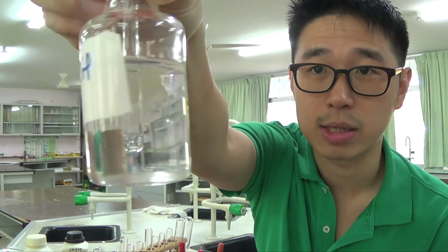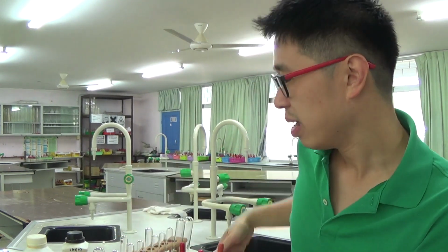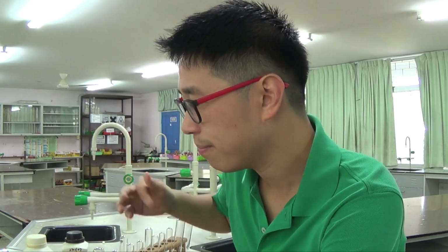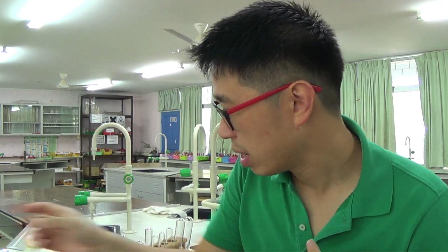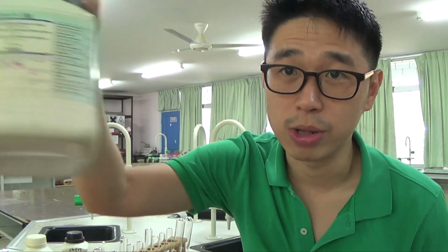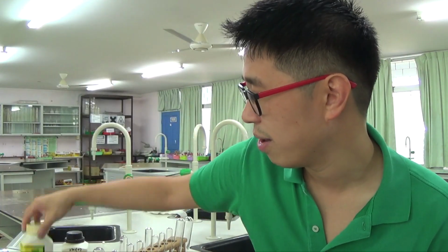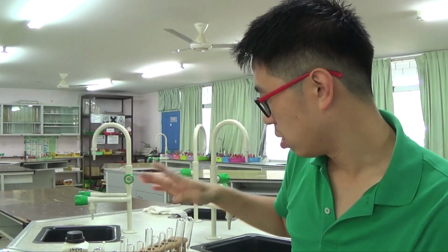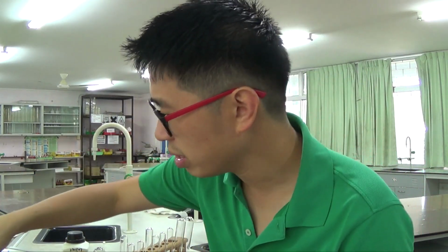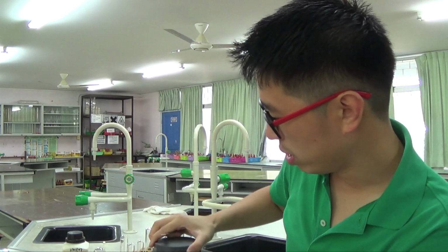So it's a colorless solution, and in the presence of ammonium ion, it will not do anything until you heat it. Okay, so that's what I'm going to do today. I'll start off with, what should I do? So I have my ammonium chloride solution, but I have my ammonium carbonate solid, and I have my ferrous ammonium sulfate. Okay, so what I'll do is probably I'll scoop a little bit of the solid. So this is ammonium carbonate.